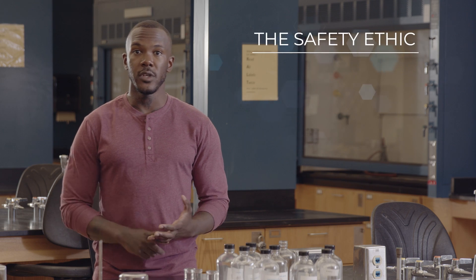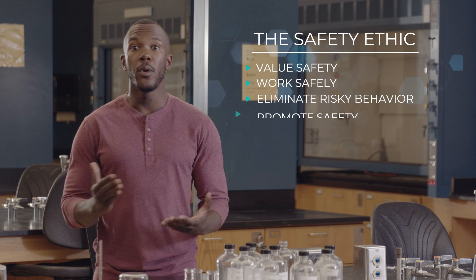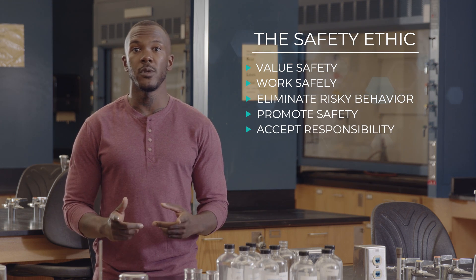The safety knowledge and skills that you learn in your chemistry classes are greatly influenced by the culture of your institution. As you start working in the lab, you should think about how you can contribute to this culture. A positive culture of safety requires you to do your part. This starts with the right attitude and ethics: value safety, work safely, don't engage in risky behavior, promote safety, and accept responsibility for safety. Everyone using chemicals in their career needs the right knowledge, skills, and attitudes to work safely in the lab. Keep safety at the forefront in your chemistry and science education, and it will serve you well.